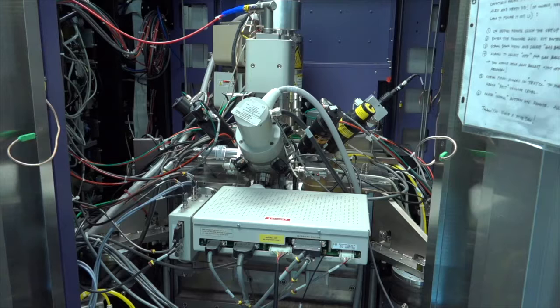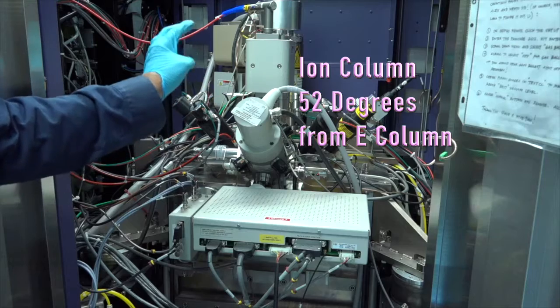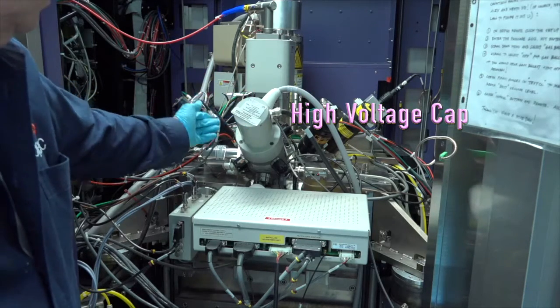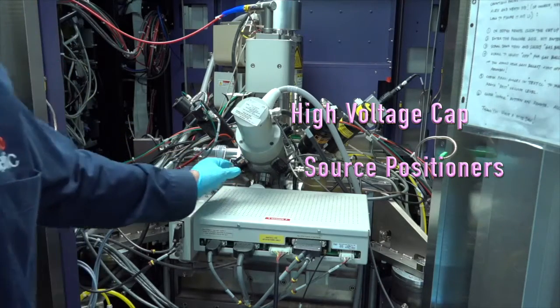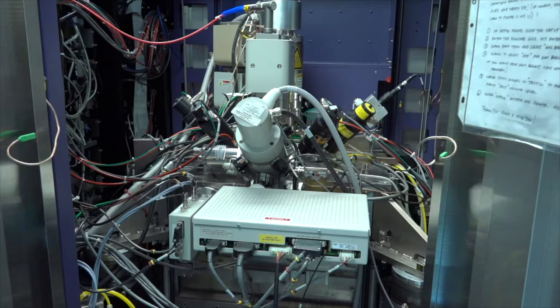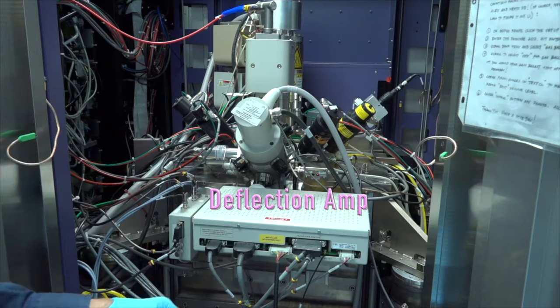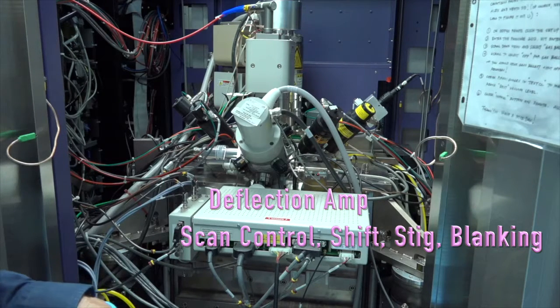On the back of the tool now, and we're looking directly at the ion column. It's at an angle, it happens to be 52 degrees from here. And this is the high tension cap for it. We've got a couple of black knobs here we call positioners that help us move the source to go right down in the middle of the column through several apertures. Now this box right here is the deflection amplifier that moves the beam, steers the beam, if you will, both when it scans, plus it has a DC shift, left, right, up and down. It also helps with the stig, and it's a very important box.